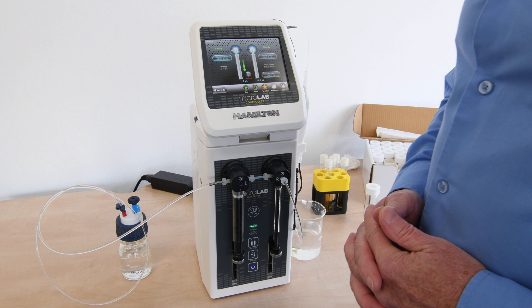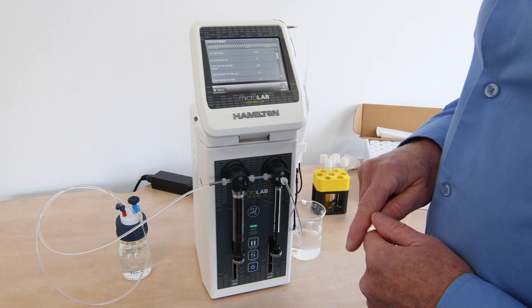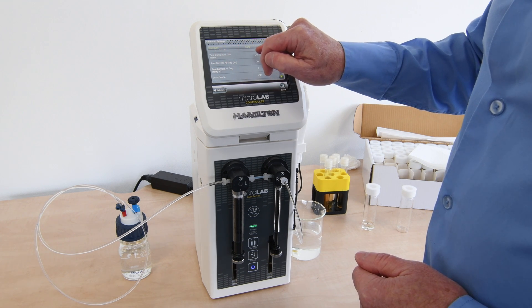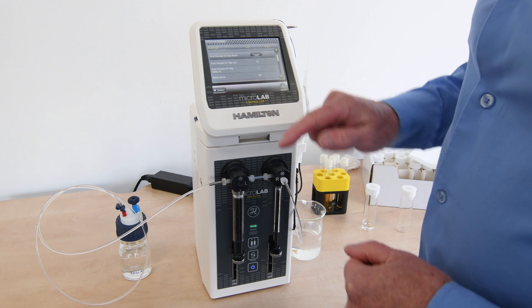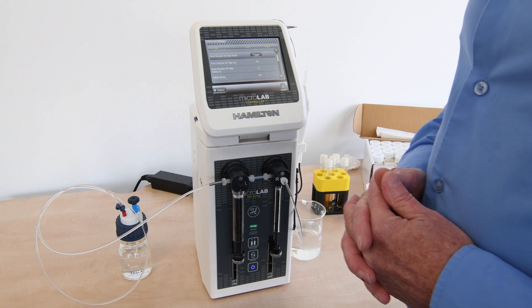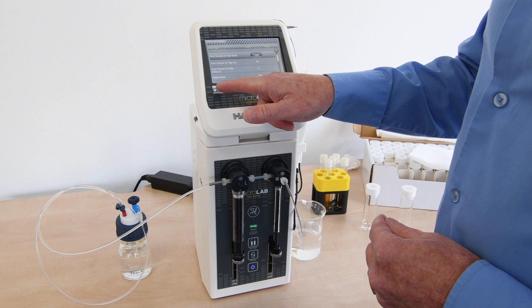We've seen the use of a pre-sample air gap being aspirated. We also have an option to take a post-air gap sample. Going into advanced settings and scrolling down, there's an option for post-air gap, which we can turn on and actuate by trigger. In the first mode, the air gap was aspirated automatically, allowing the user to go straight to sampling. Here we want the user in control, so the air gap aspiration occurs with the actuator, with 20 microliters defined.